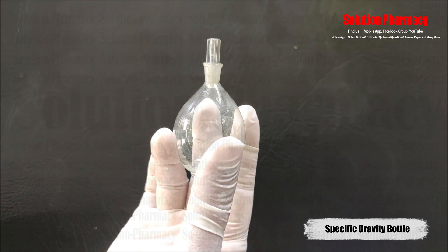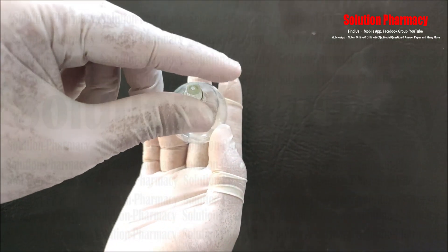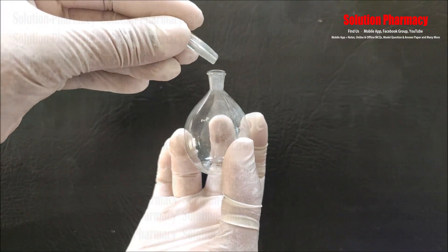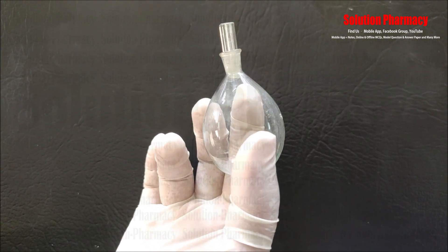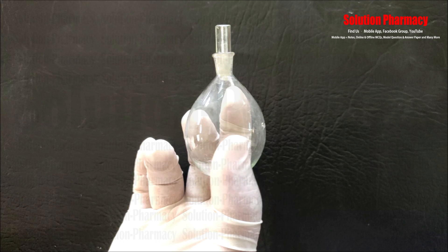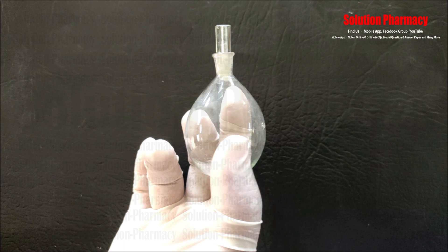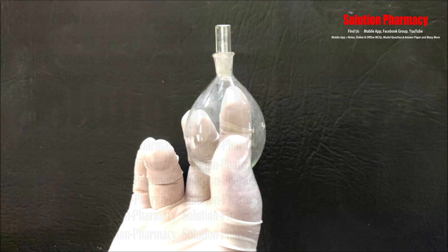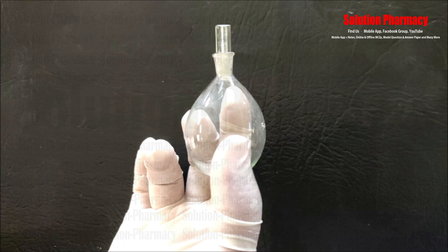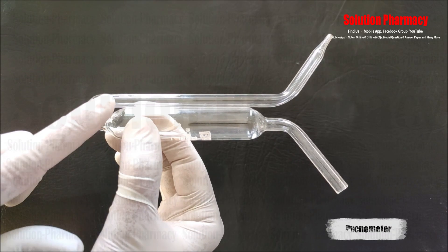Next, this is called a specific gravity bottle, used to determine the specific gravity of any liquid. It has a glass stopper which consists of a capillary inside it. Specific gravity is also called relative density — the density of a liquid determined by comparing it with a reference substance like water of known density at a particular temperature. Practical videos on determining relative density using this bottle are available on their channel in English and Hindi.